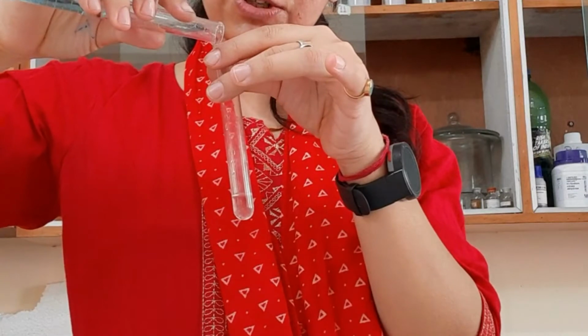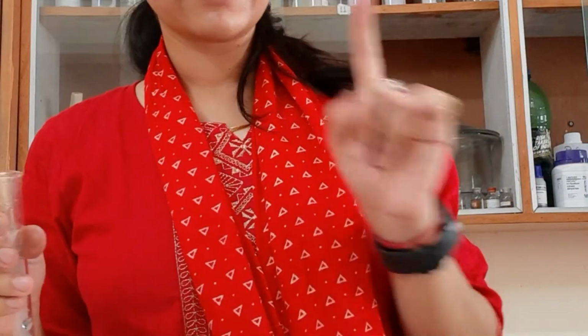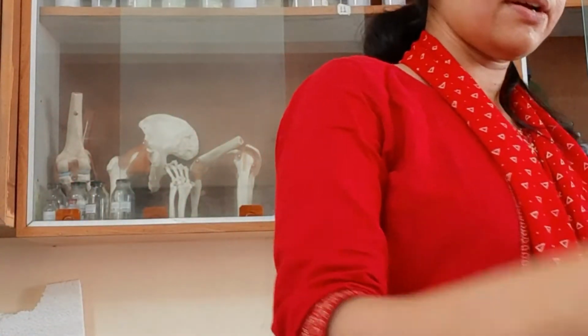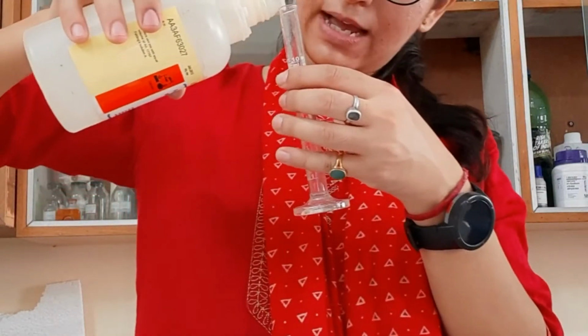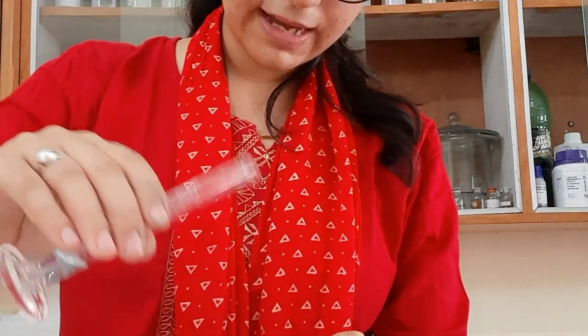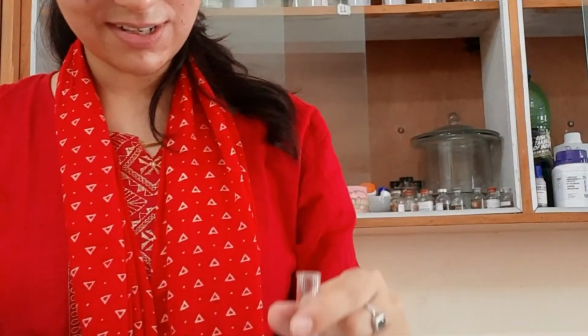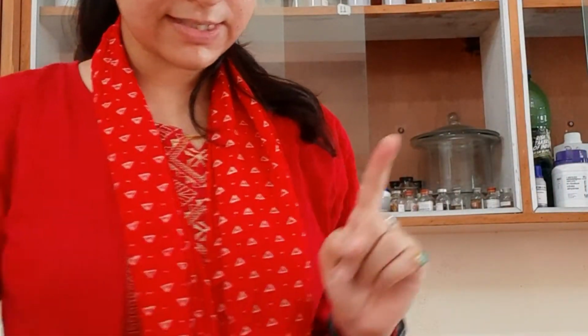This is 2 ml, and I am going to add it to the urine sample in my Fehling's test. So here the 2 ml is gone. That was the A. Now we need Fehling's solution B. Here is our Fehling's solution B, 2 ml. That will also go in our test sample. As you can see, there is a change in color now. Now the third step we have to perform is to boil. Again you have to boil.